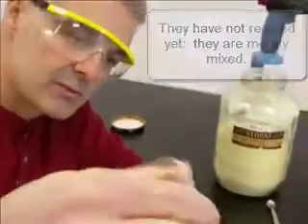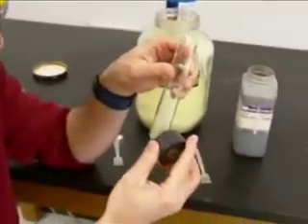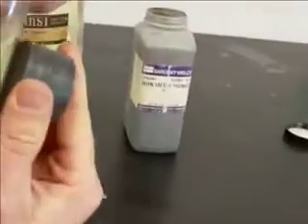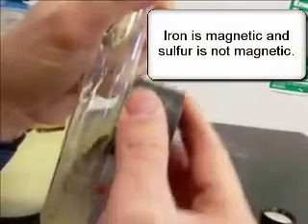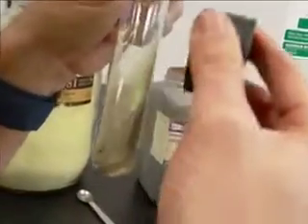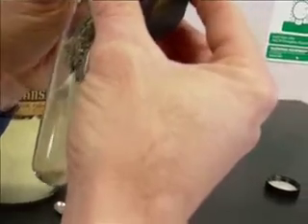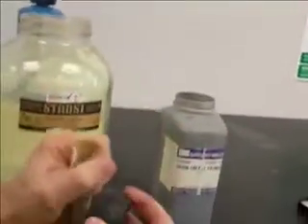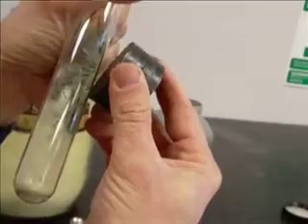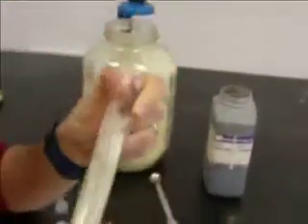Okay, mix, mix, mix. And they still haven't reacted. Now, one way I can know that is I happen to have a magnet right here. And if I take the magnet, I don't know if you can see this. I think you can. I can move the iron. Iron, of course, is attracted to the magnet. So I can do that. The sulfur stays at the bottom. You can kind of see how the sulfur is not attracted to the magnet, but the iron is. So now this is essentially just a mixture of iron and sulfur.